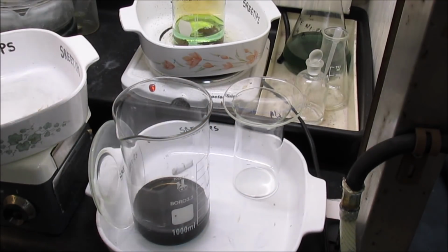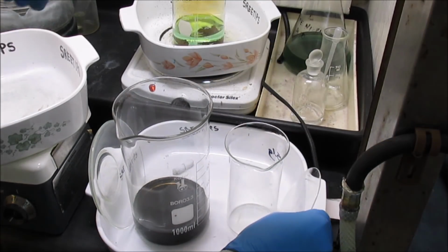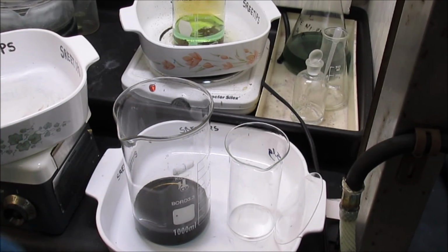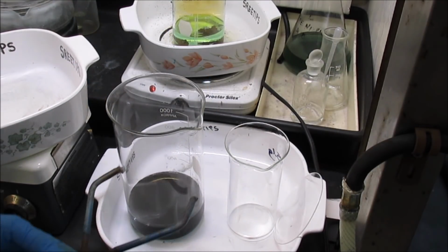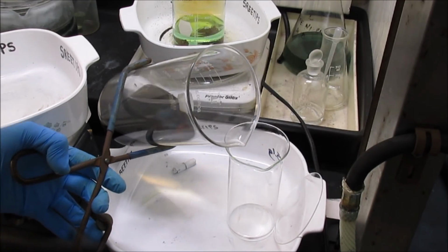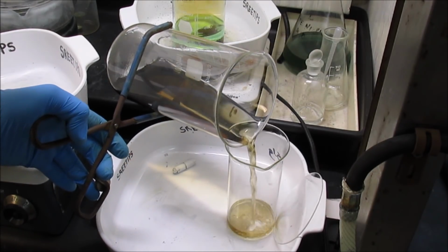Now we'll transfer that hot solution into this tall beaker. Putting it in this tall beaker helps when I go to decant the waste solution, because it decreases the surface area of the metals, the black powder, and forms a taller column that's easier to remove that liquid from.